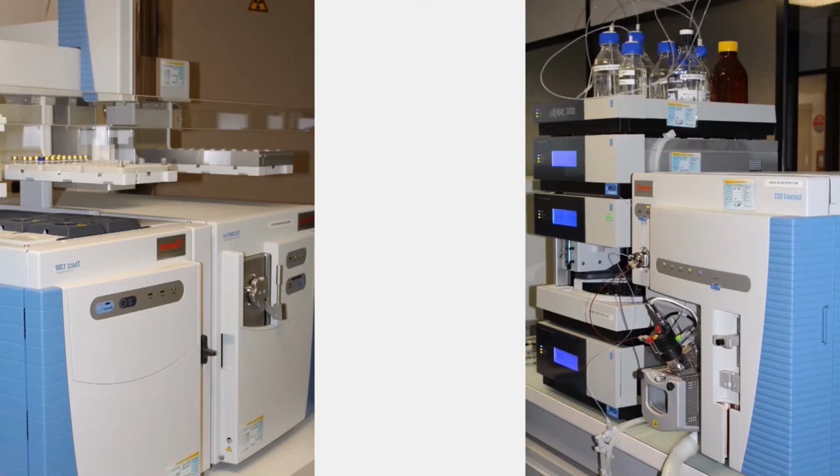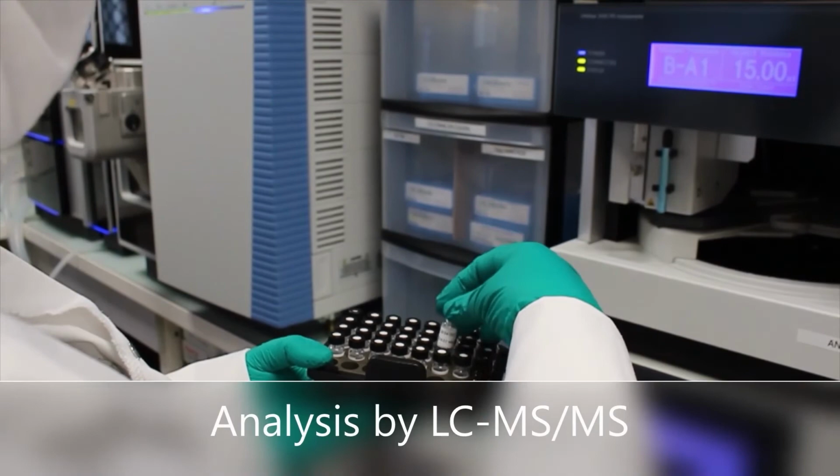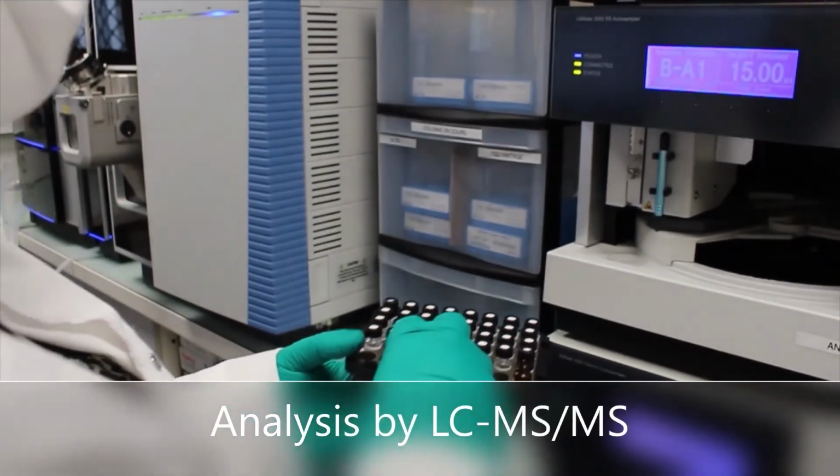After preparing the sample, and prior to injection, the instrumental parameters of the chromatography system and the mass spectrometer are checked. Once LC-MS-MS and GC-MS-MS are ready, the analysis of the samples can begin.